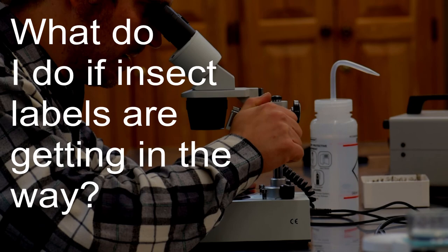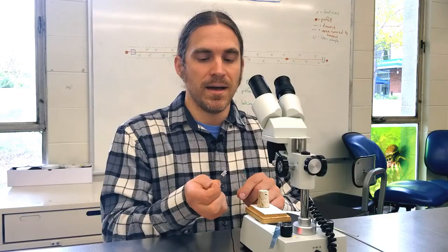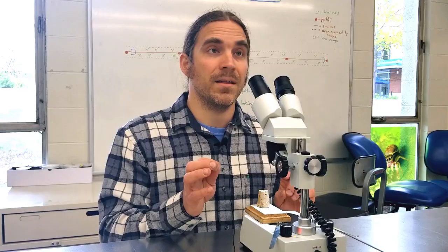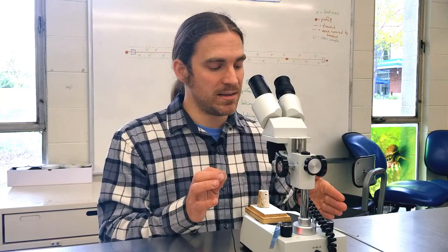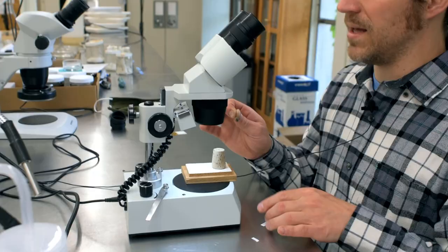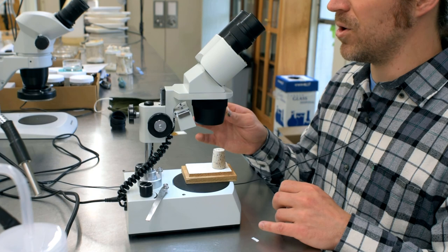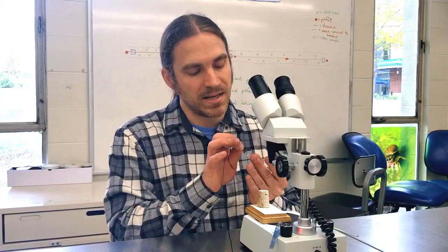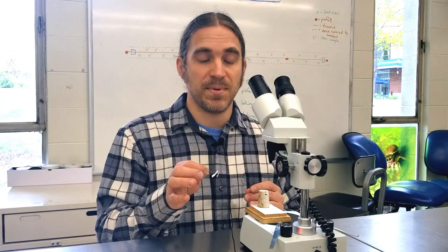Sometimes when working with specimens, the labels get in the way — it's very hard to see the underside of a specimen while labels are there. You can take the labels off, but put them to the side and don't lose them, because if you lose those labels and that data, the specimen becomes useless. Don't have labels off more than one specimen at a time. As soon as you're done looking where you need the labels off, put them back on before moving to the next specimen, because if labels get mixed up or lost, all the time and effort that went into collecting and curating that specimen is wasted.